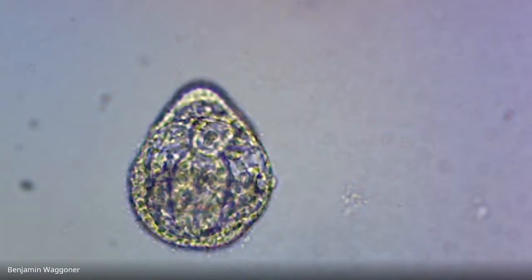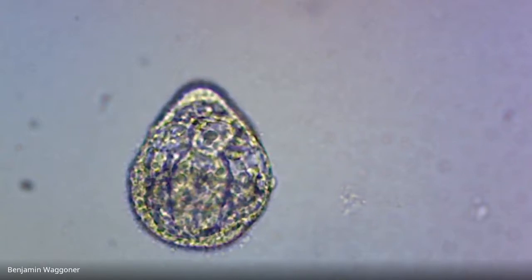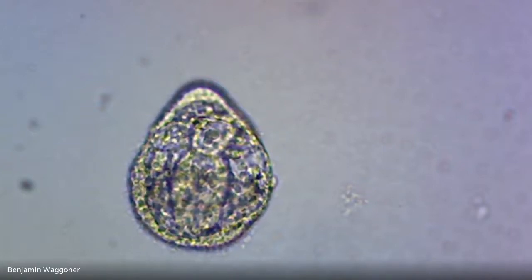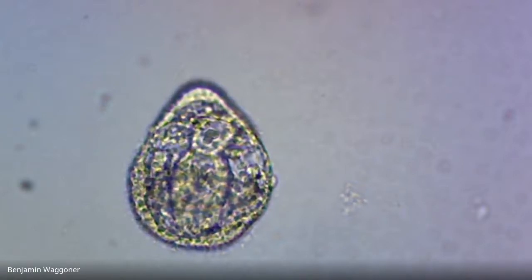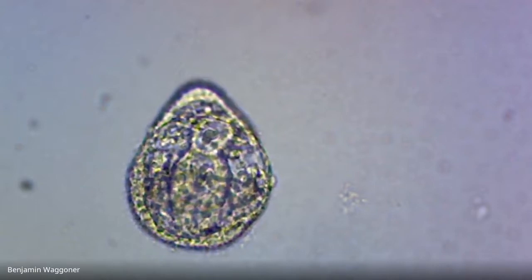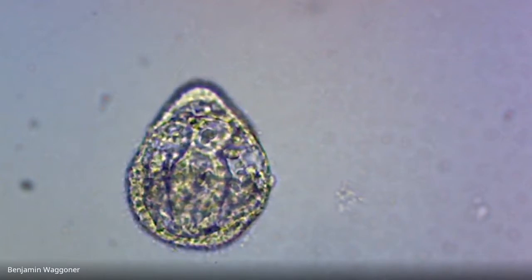What I do have, which I should have included in the handout, but I will send it out to you separately, is data on how fast development is supposed to go for larvae being kept at room temperature. At the very least, we can use that as a control. We can compare what we're seeing in our nickel larvae to the tables of normal development times and see if the nickel larvae are developing on schedule or if they're developing too slowly.